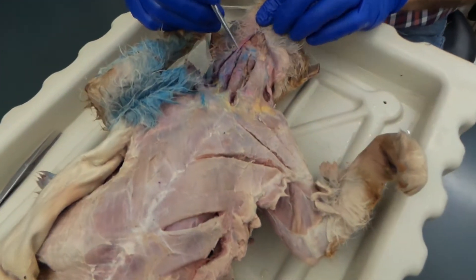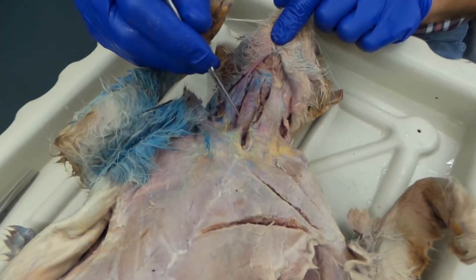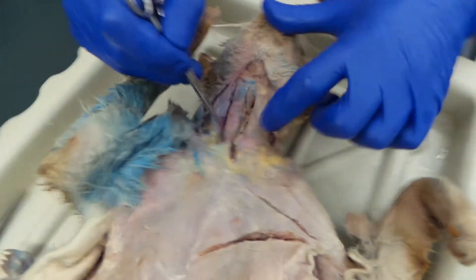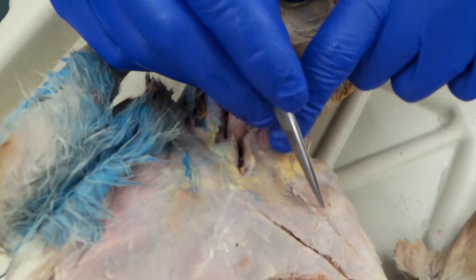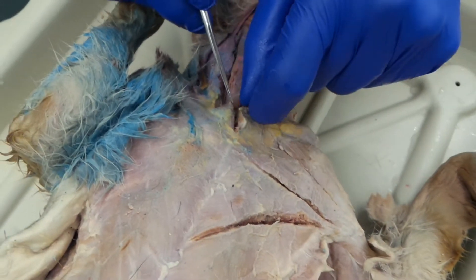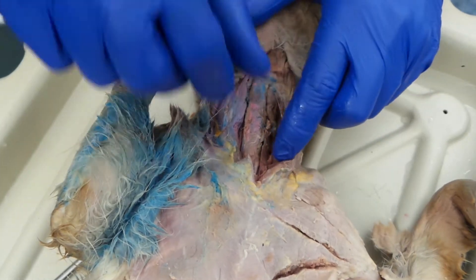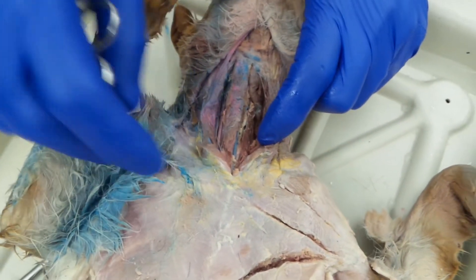This is the third day dissection. We're going to do the neck. First thing you want to do is clean up some of the muscle around the neck, and then kind of cut down towards the pectoantibrachialis. Once you do that, kind of push the chin up, and we can begin to see some of these neck muscles.